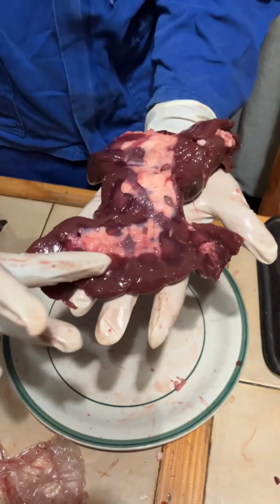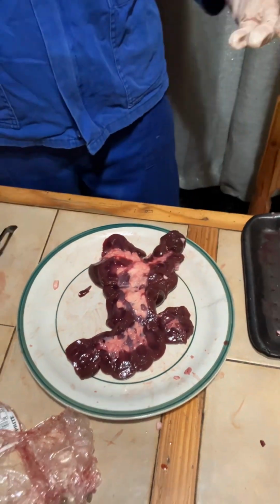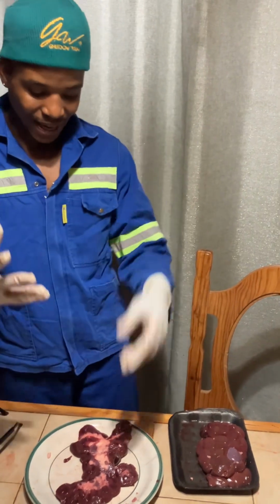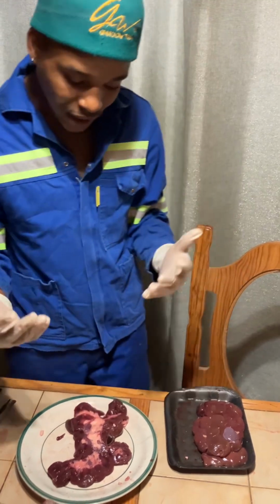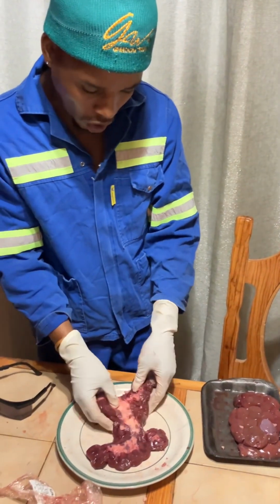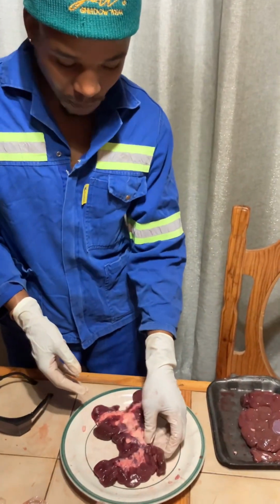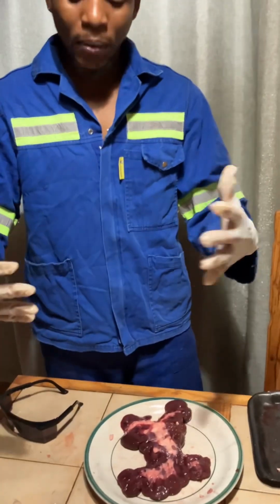Now the glomerulus, you won't see it with your naked eye, but basically it acts as a sieve of the kidney. It sieves each and every unwanted fluid or unwanted waste in the kidney. The other interesting fact about the glomerulus is that 20% of the fluid that enters the kidney is filtered or cleansed by the glomerulus. Okay, now it is important to understand the fluids that operate within the kidney.